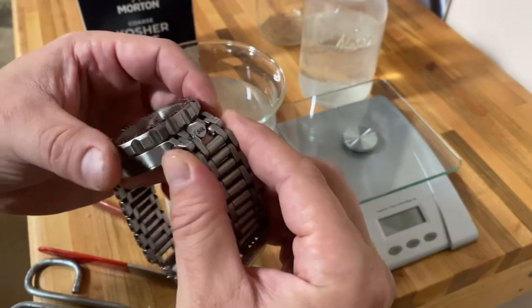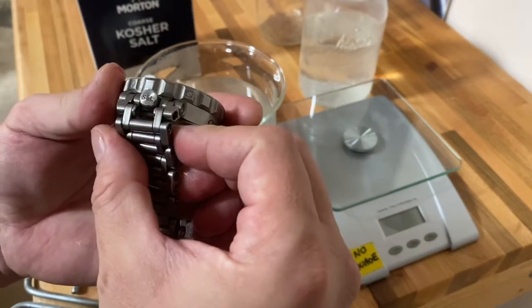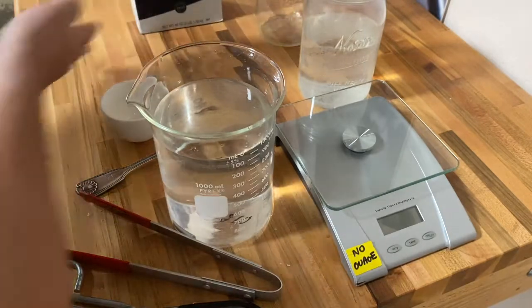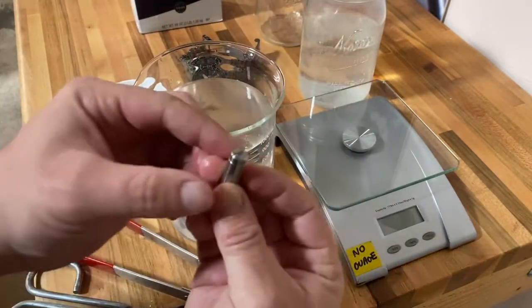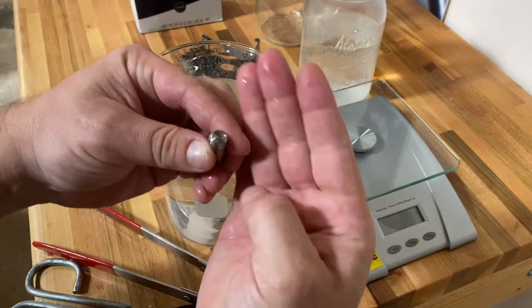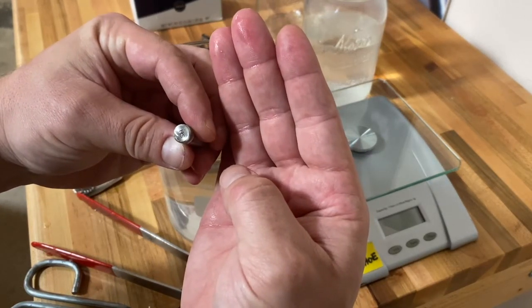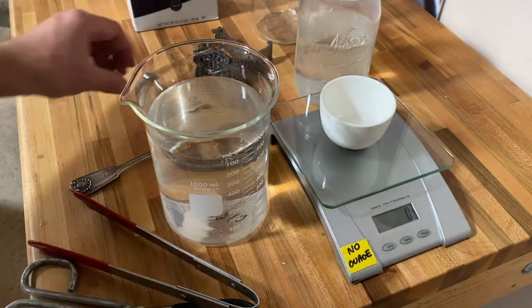We're going to need to let this dry, let it oxidize, and see if there's a reaction happening as it dries. I'm going to set it right here along with the rod blank, which has also been in there. I don't see anything on that either yet — looks super clean — but I'm going to let this dry. Alright, let's check in on the science experiment.